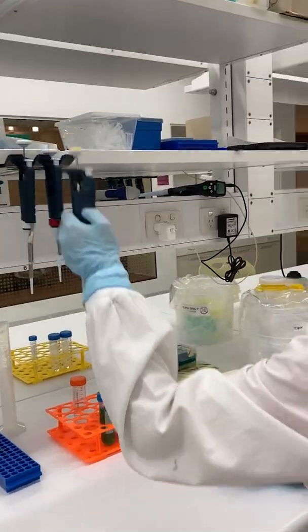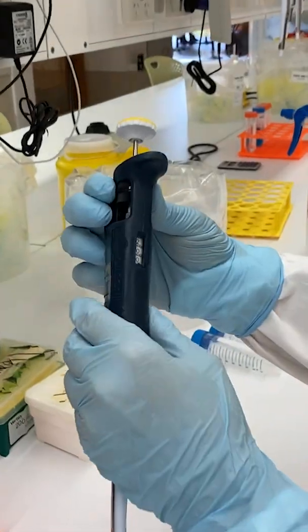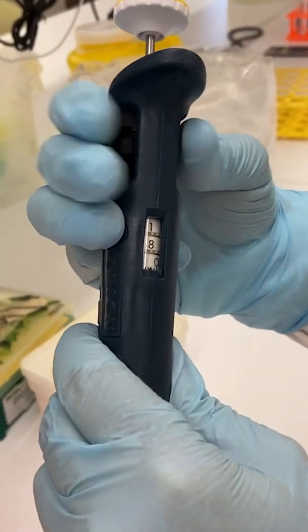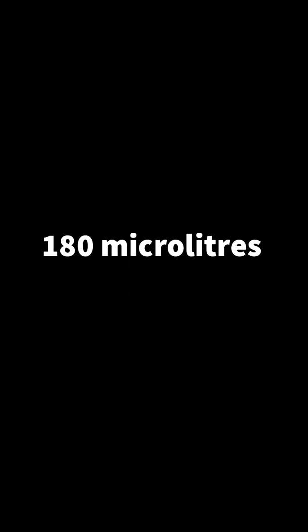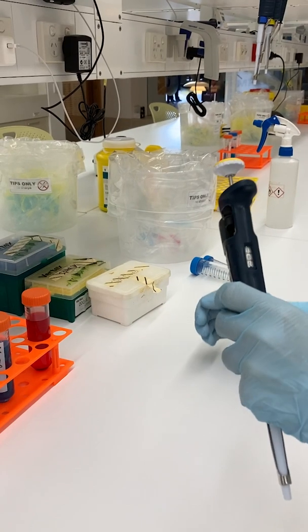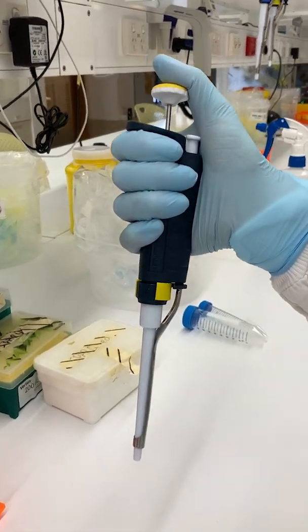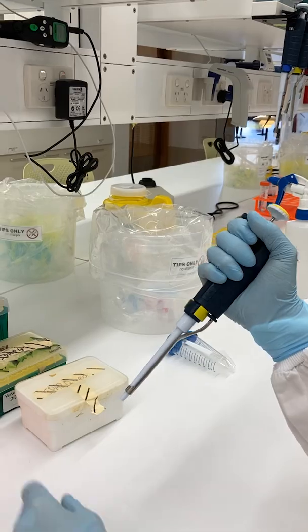In the laboratory, we commonly use the P200 pipette. To begin, turn the thumb wheel until you reach the volume you wish to dispense, as viewed in the side window of the pipette. On a P200 pipette, a reading of 180 indicates a volume of 180 microliters. Now hold the pipette in your dominant hand as shown, with the thumb reaching over the top of the small white ejector button to rest on the plunger.